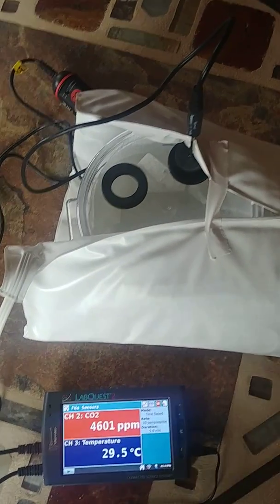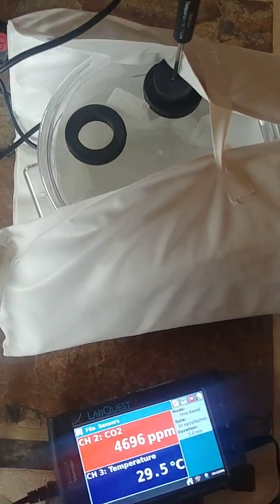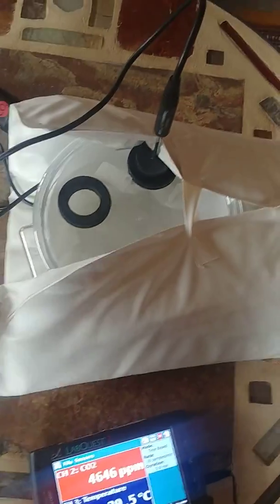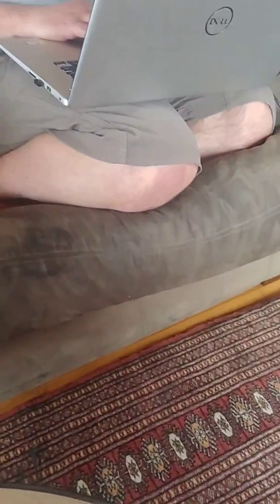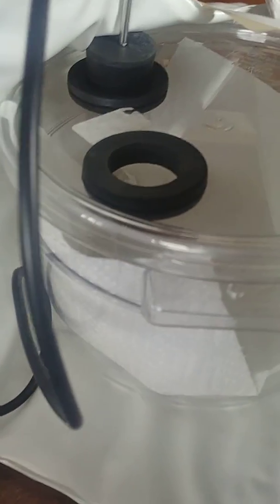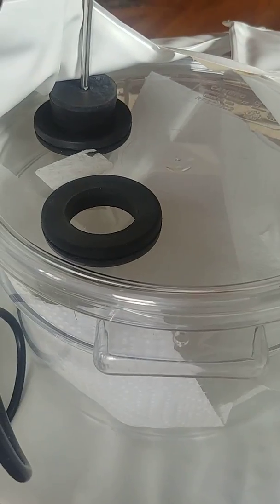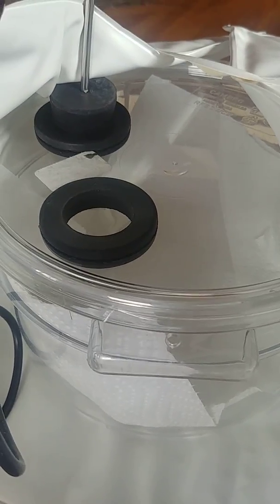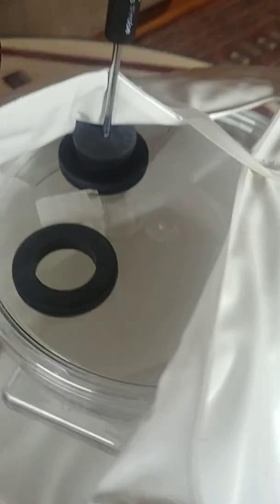All right everybody, here's our experimental setup. So what we've got going on here is this plastic, whoa buddy, sorry my gecko is escaping, this plastic metabolic chamber here. That's where we're going to actually put Wallace to measure his metabolic rate and then this is wrapped in a heat pad to get it warm.